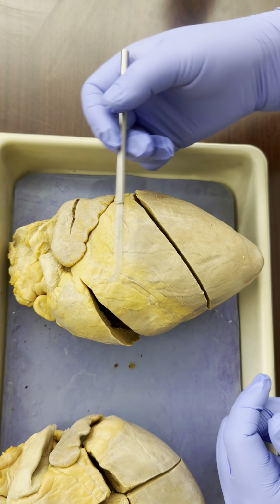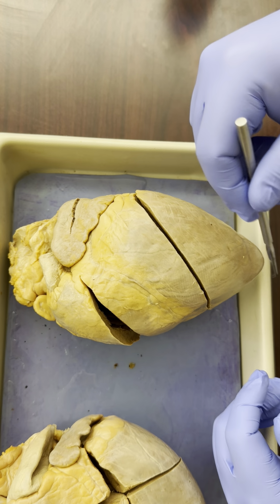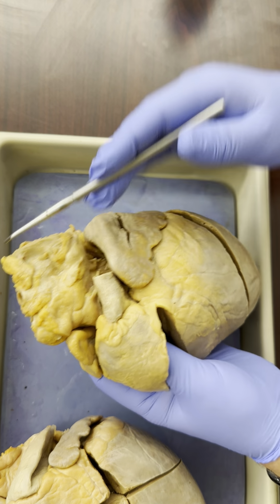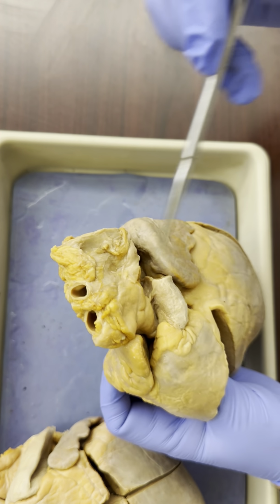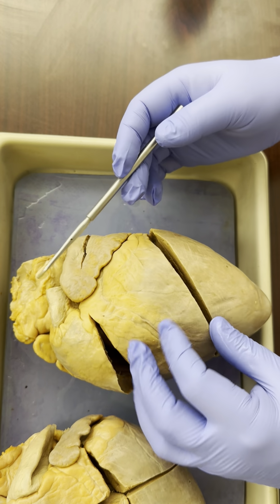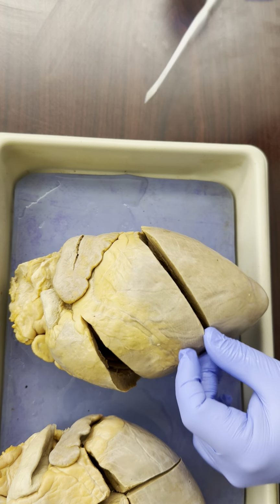Now this is a pig heart, so some of those terms don't really make sense, but assuming that this was a human heart, the apex points towards the ground. It is inferior. And then on the other side, we have a lot of vessels coming out at the top of the heart. And the vessels that we can see from this side, these are all on the superior part of the heart. So superior vessels, inferior apex.